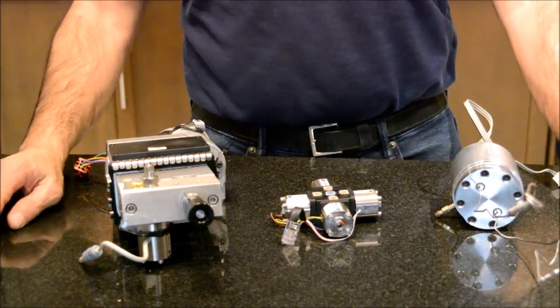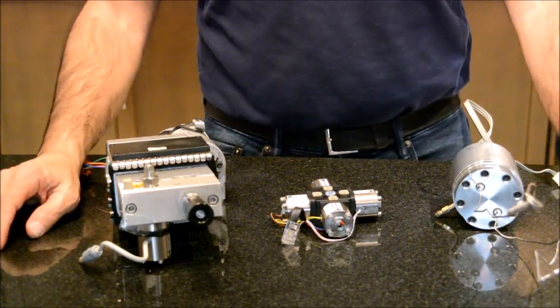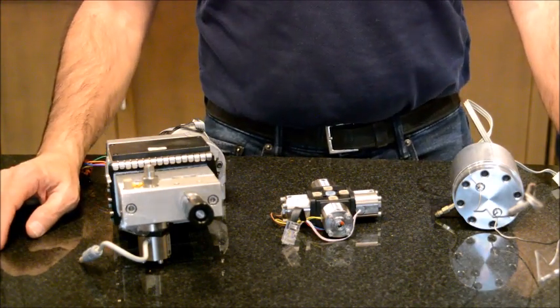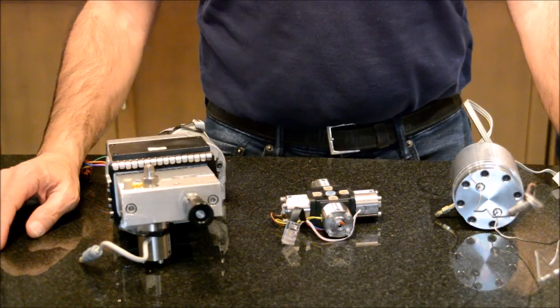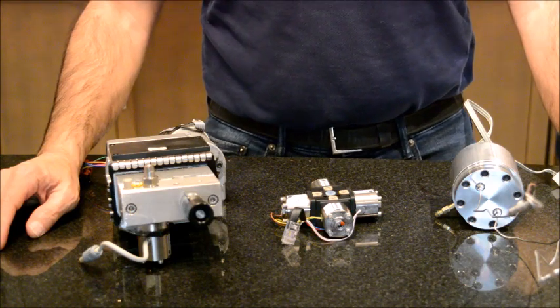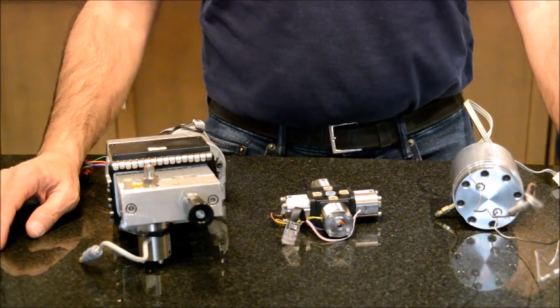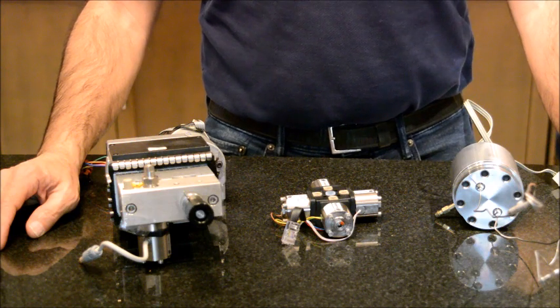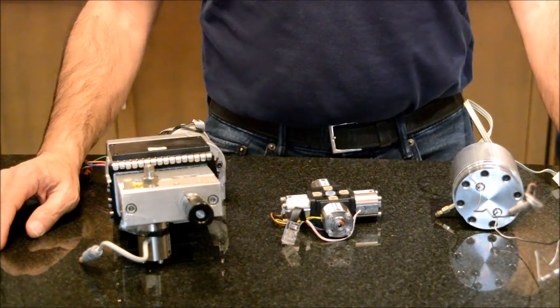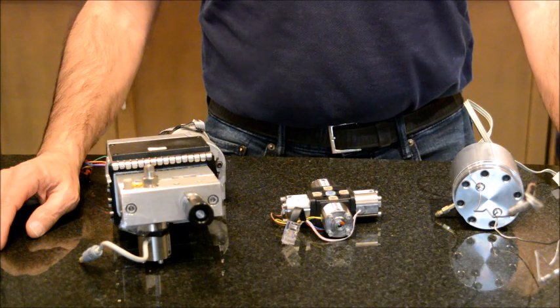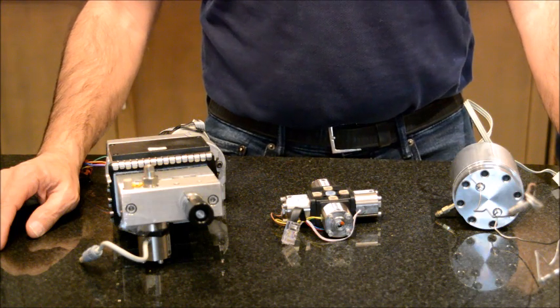Hello everybody, thank you for choosing to watch another video from this channel. Today I'm going to talk about HPLC Agilent and HPLC pump and pump-related problems that you may encounter during your HPLC analysis. This is the second video about this subject.